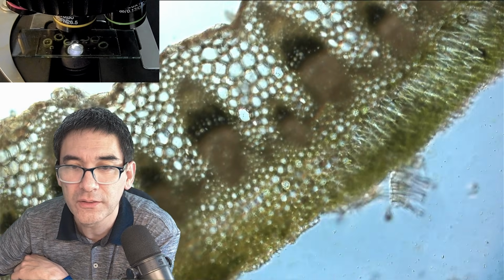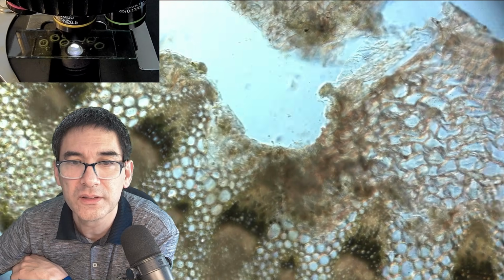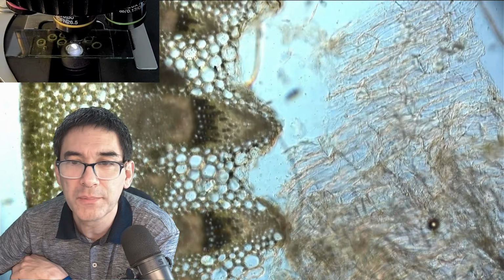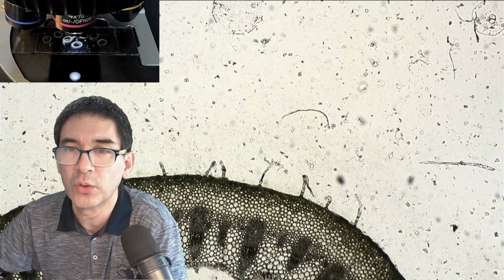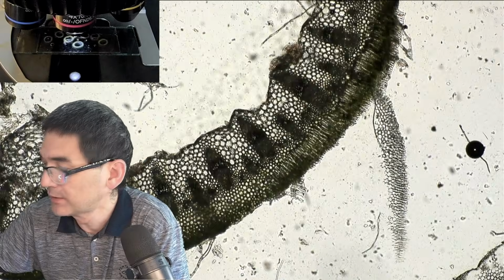So very nice, very nice, very nice. It's a little bit destroyed here, but that's okay. Overall, I'm very happy. You know what I'm going to do, I'm going to go down a little bit with the magnification. Maybe we can have a look at a few others as well. That's very, very beautiful. We just ignore all of the junk over here. But let's have a look at another one over here.